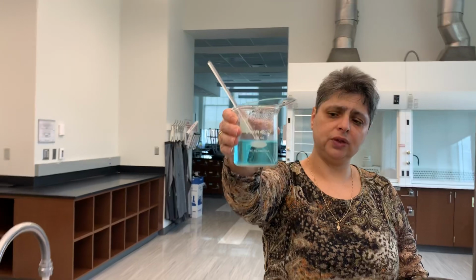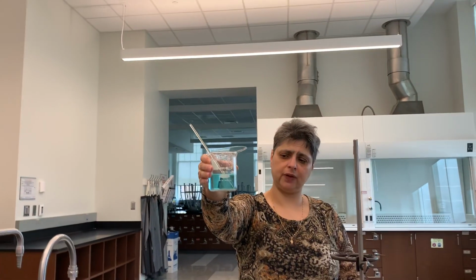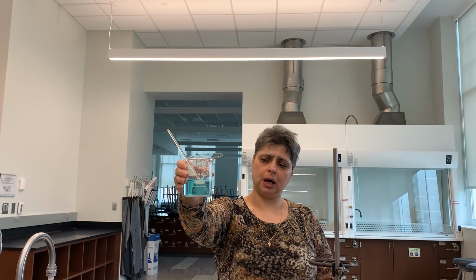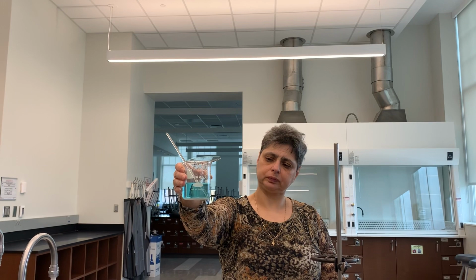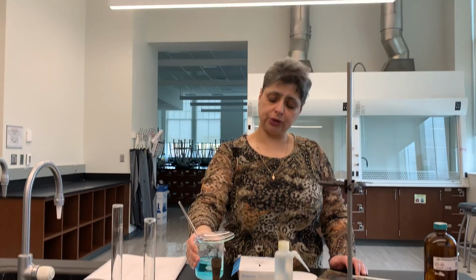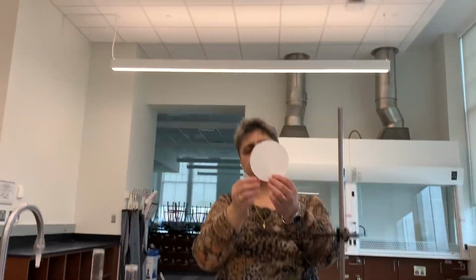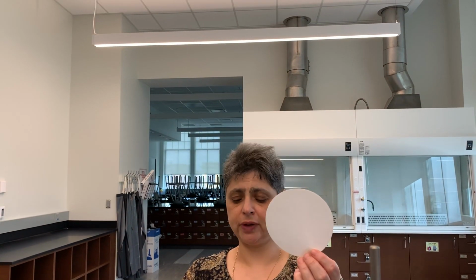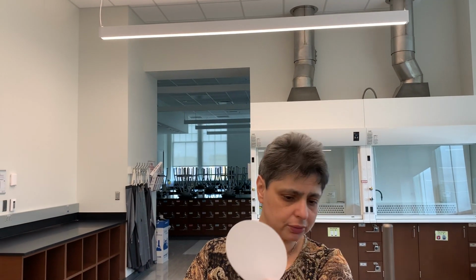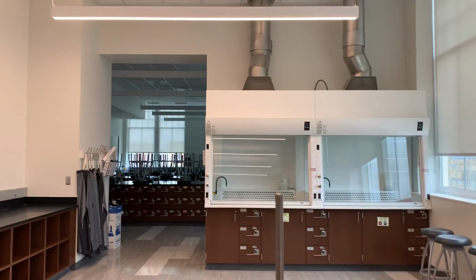And then in a later video, we will show you how this barium sulfate can be weighed after the filter paper used to hold it during filtration is burnt off. So what I have here is filter paper. This is a circle that will fit in a glass funnel, which I hopefully have here. Yes, I do.